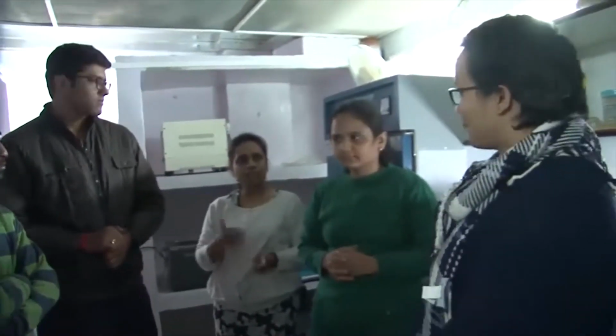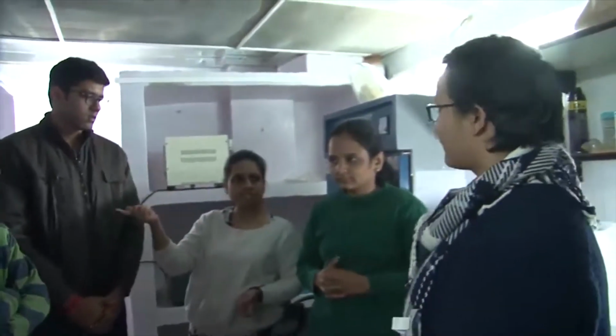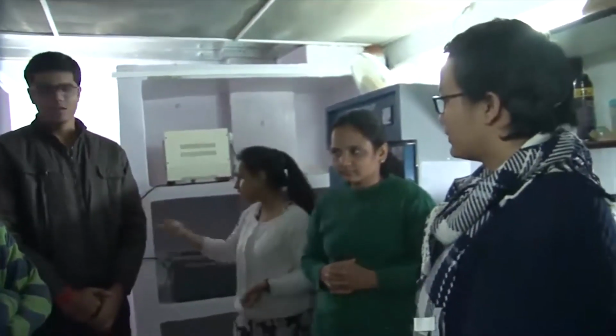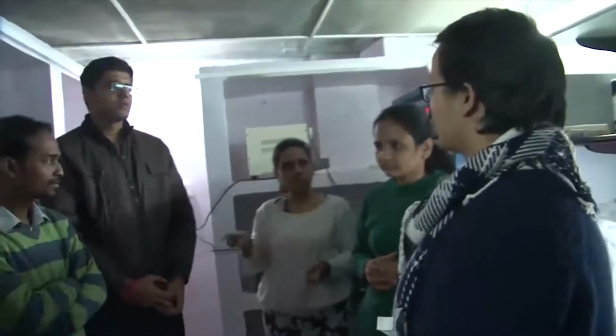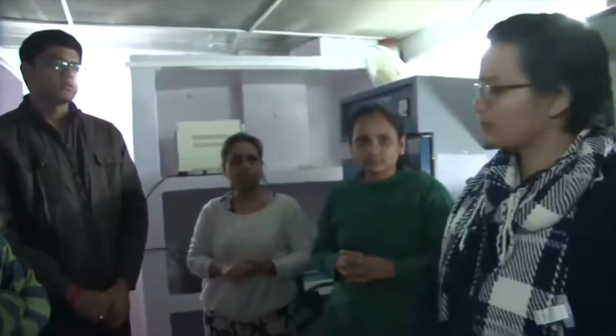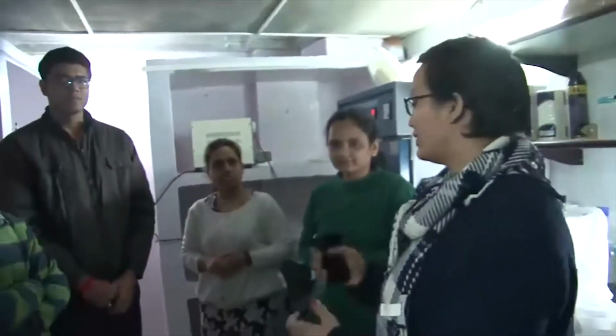In our lab we have 2 species. This is a species which we got from the Malaria Institute in Delhi, and this is another species, Liverpool. Their whole genomes are sequenced, so such studies can be done. Thank you. This was Dr. Nitin Gupta's team from our department, and I thank you all.